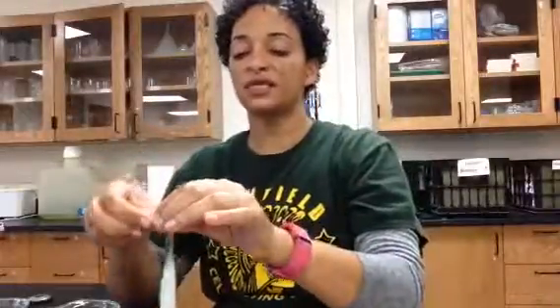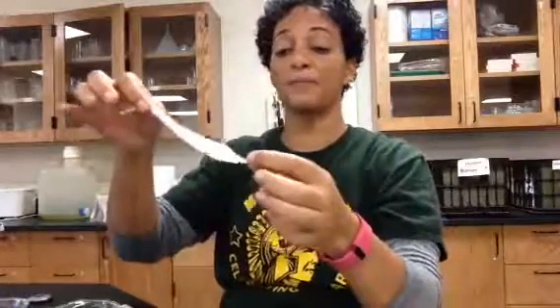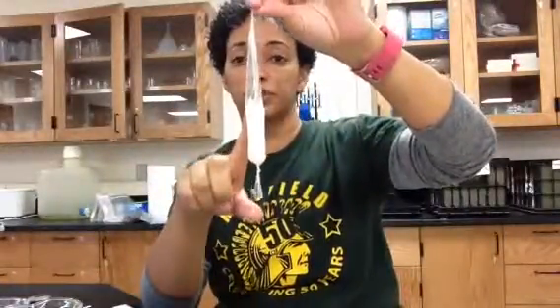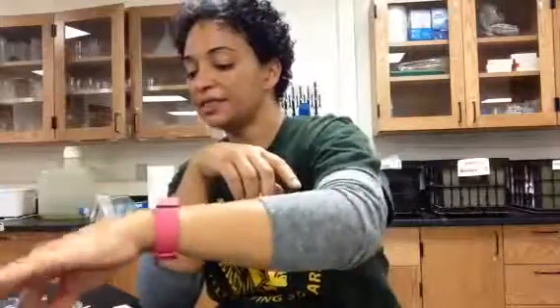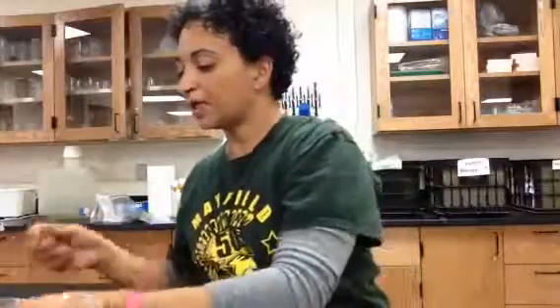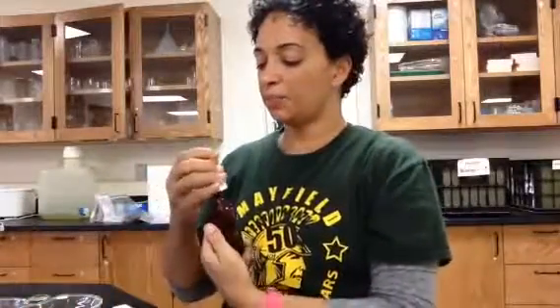I'm going to make sure there's no excess air in there and tie another balloon knot at the top. This is kind of like a model cell — we want to see what sorts of things can diffuse across its membrane. I'm going to get my beaker and put 200 milliliters of water in it, then place my model cell into the beaker so it's completely submerged. Using my pipette, I'm going to put three to four drops of iodine in the water.